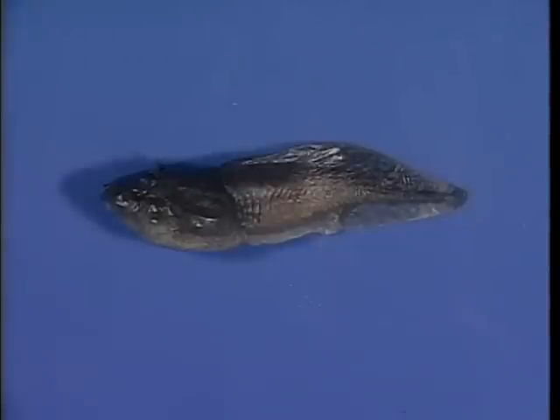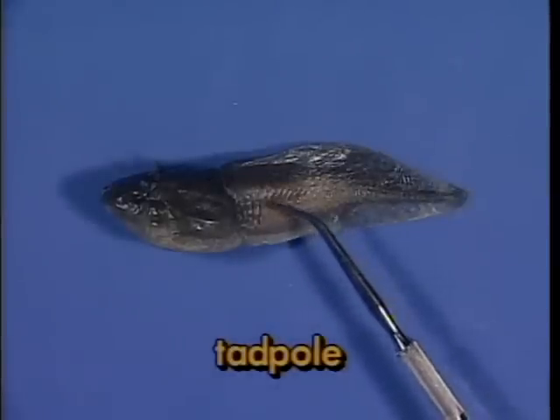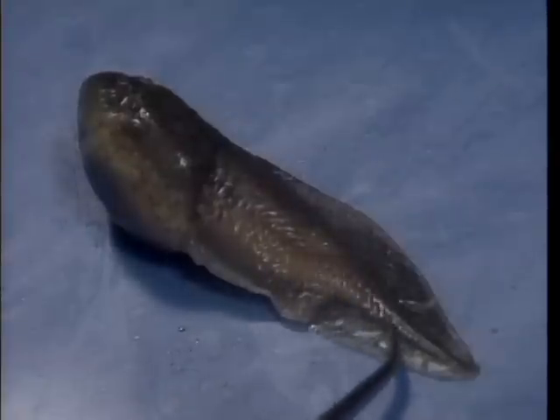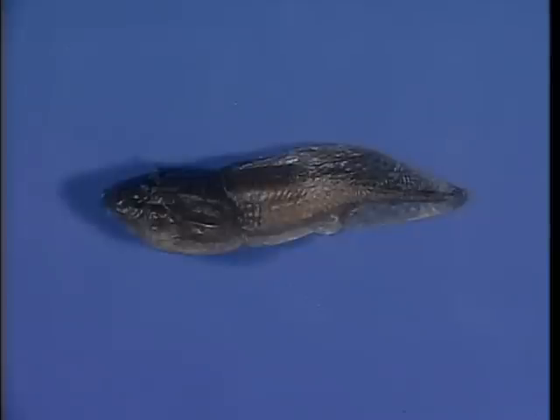Successful fertilization of an egg by a sperm results in an embryo. Embryonic development results in a tadpole, which looks like this preserved specimen of a bullfrog tadpole. In time, the tadpole resorbs its large tail, develops legs, and transforms through a process known as metamorphosis into a tiny copy of the adult body plan, and the cycle is complete.